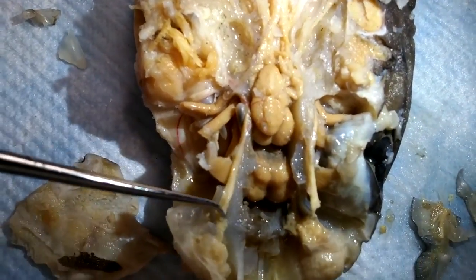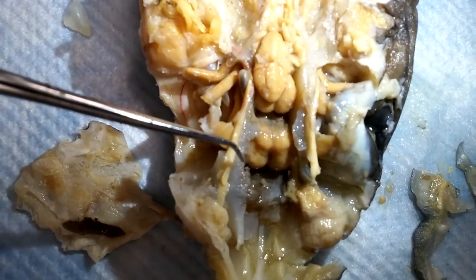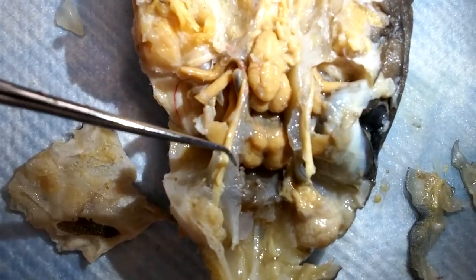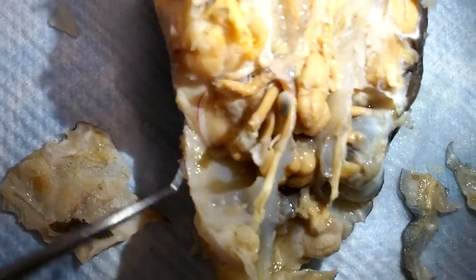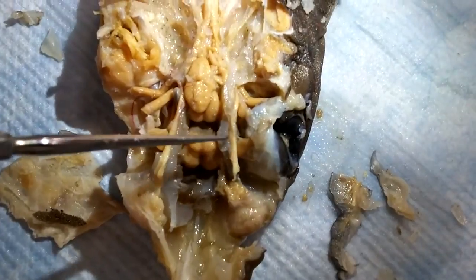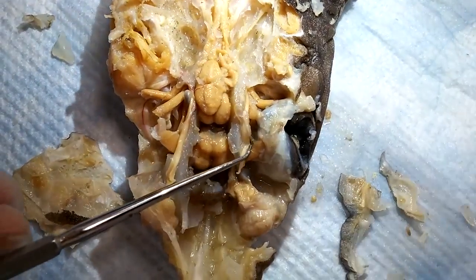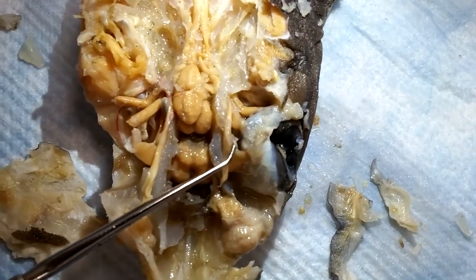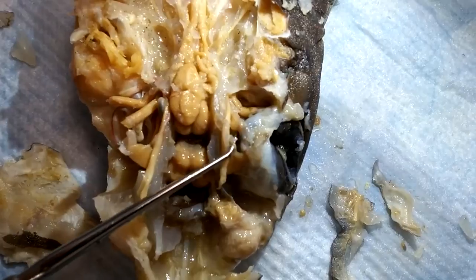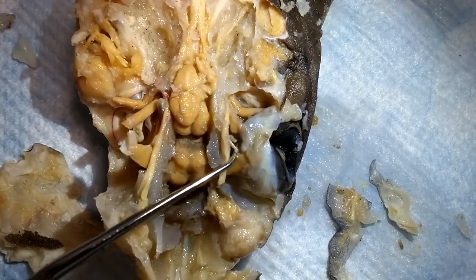This right here is the superficial ophthalmic nerve — right here, you see? This little guy. This is deep. This is the infraorbital nerve.